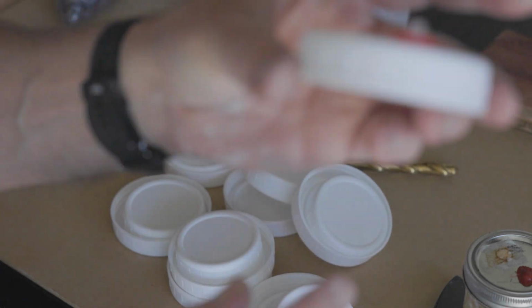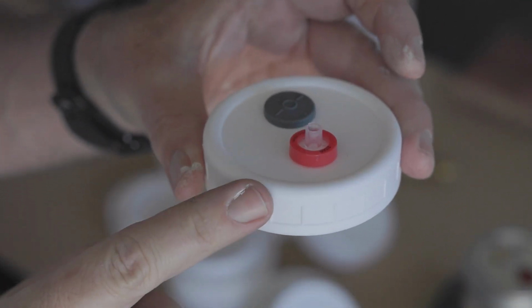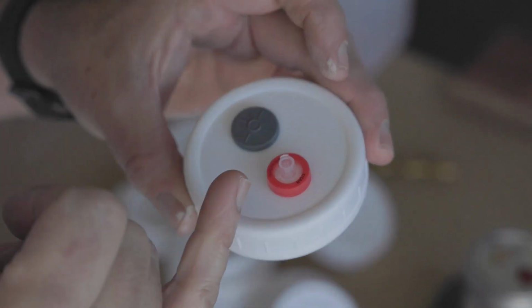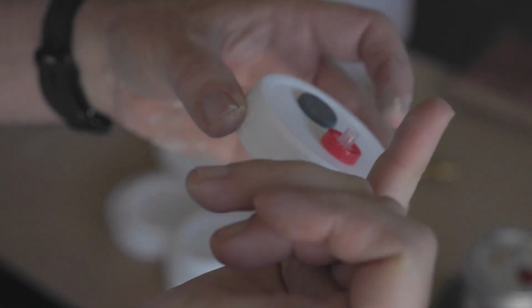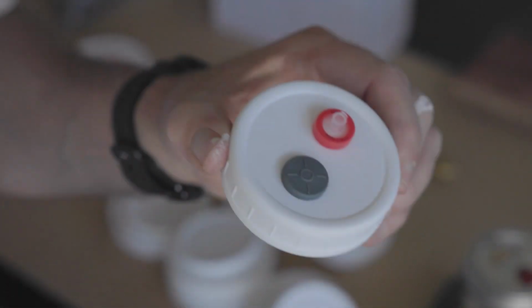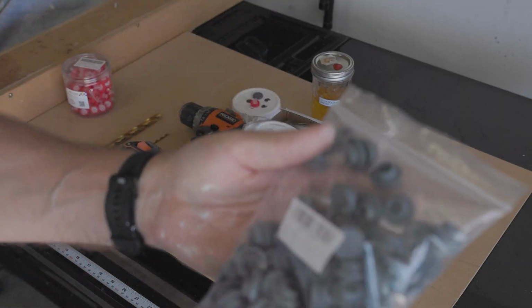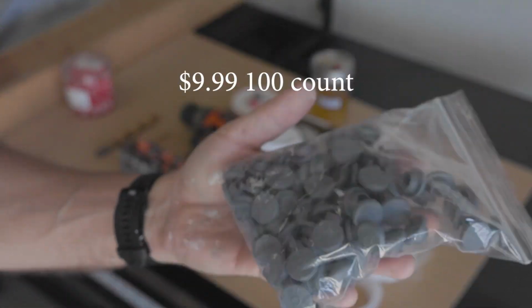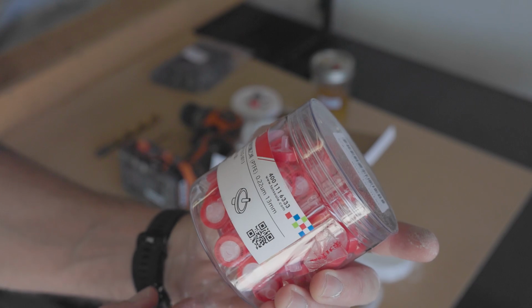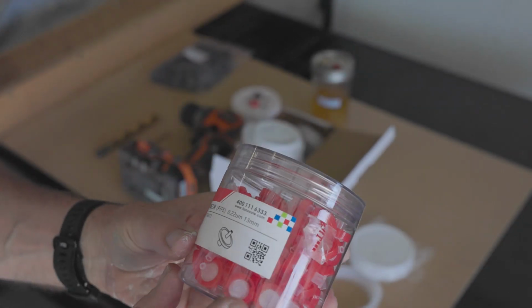So what I want is a nice plastic piece. One nice plastic piece, self-healing port, a little ventilation, be able to go out, but bacteria can't get in. It's plastic, it's gonna last forever, and it's gonna be an upgrade. So what we're gonna need here is some self-healing injection ports, and a 0.2 micron filter. That's just like your micro pore tape.